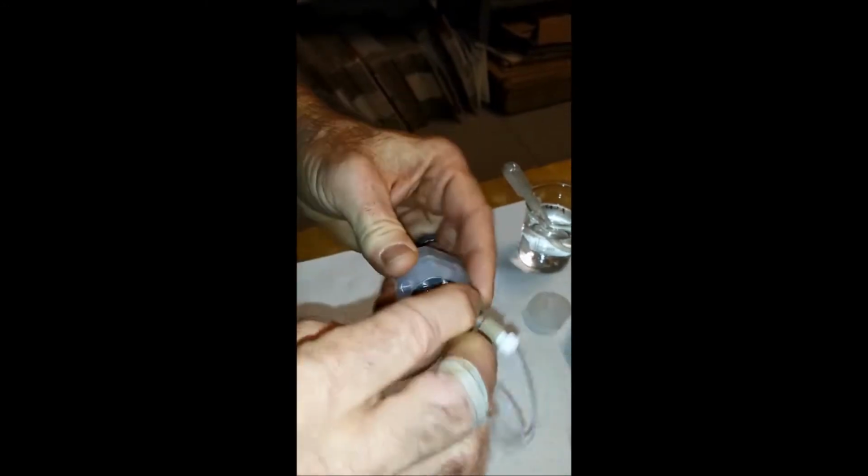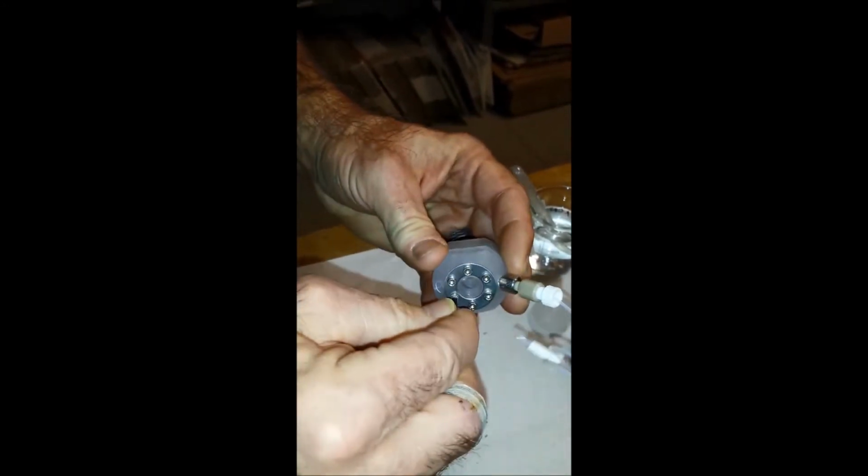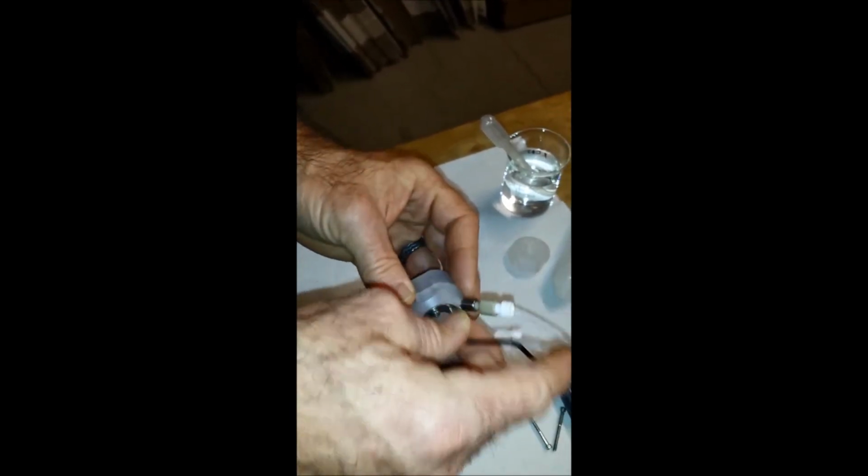What I usually do is loosen each one, and then I come and quickly turn them so that they come out. Work through all 6. Being careful not to let the nuts roll off the table.